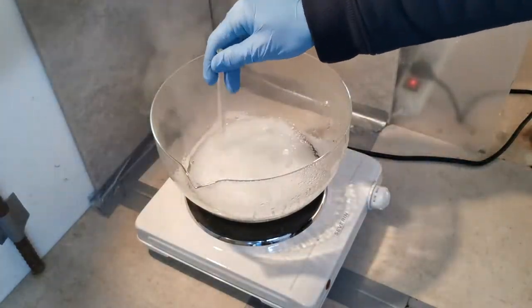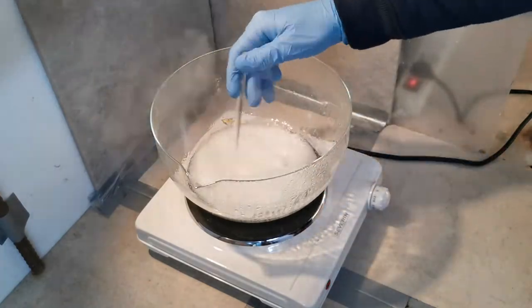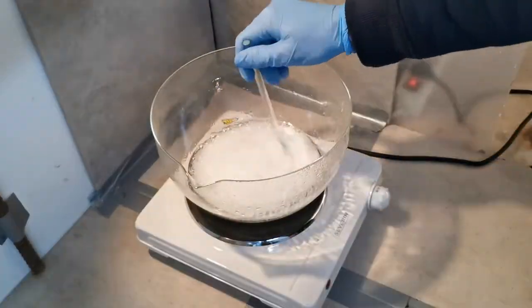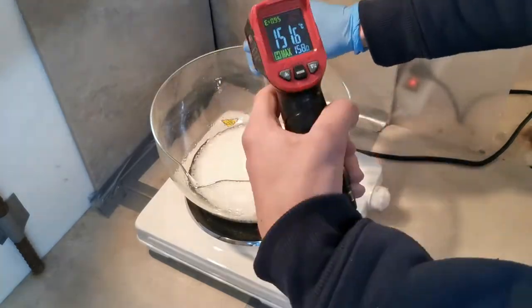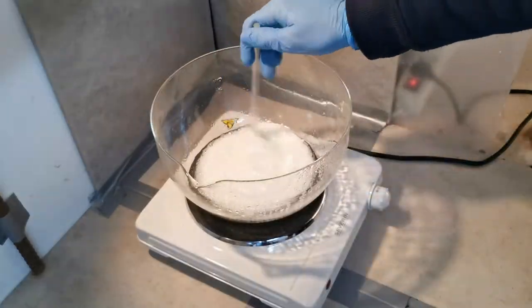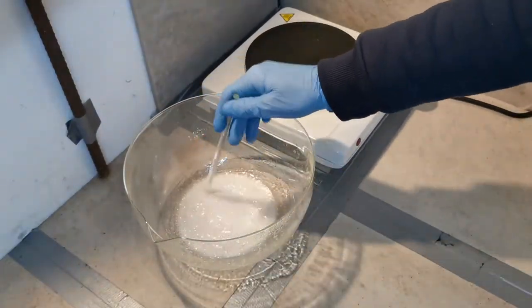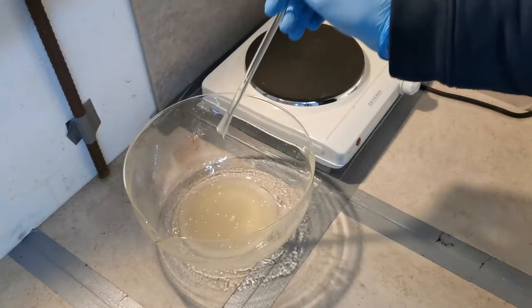So I heated it up again and boiled until it reached about 160 degrees celsius. At which point it looked like there was no more water vapor coming off. Thinking back I probably should have gone further to like maybe 200 or just held it at 160 for longer. When I let it cool down it became syrupy again. At 50 degrees it was basically like thick honey.